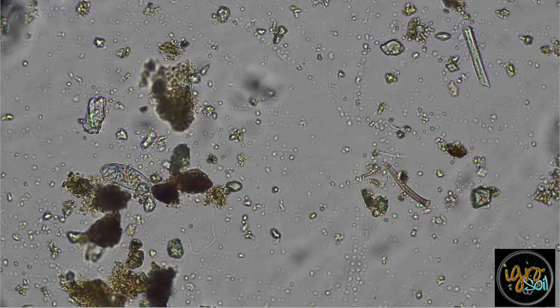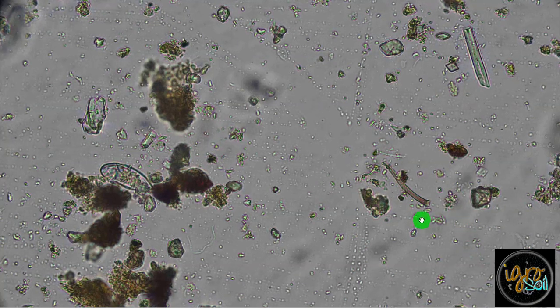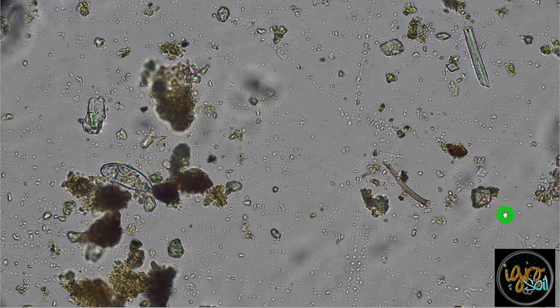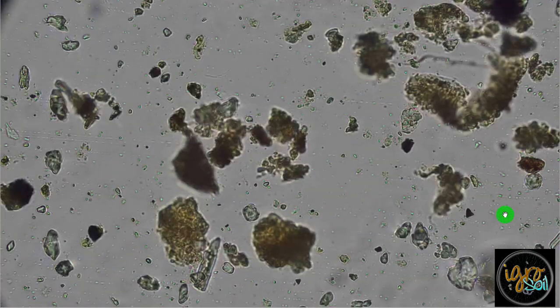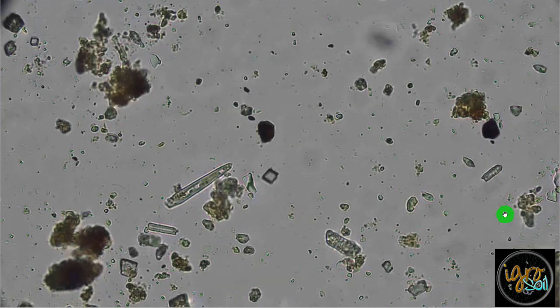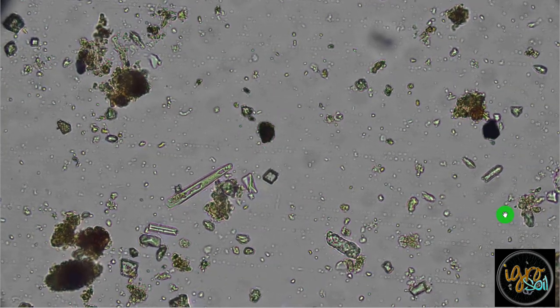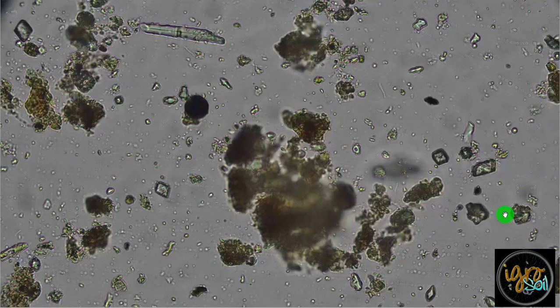That might be fungal. That might be the first piece of hyphae. I see no septa. It looks like it's going deep, like into the depth of the slide. So I can't make out a consistent fungal strand or hyphae on that. But what I can assure you is that we are finding this pathogen in here. So anyway, all right, I'll reach out.